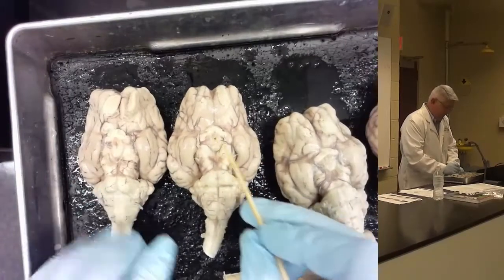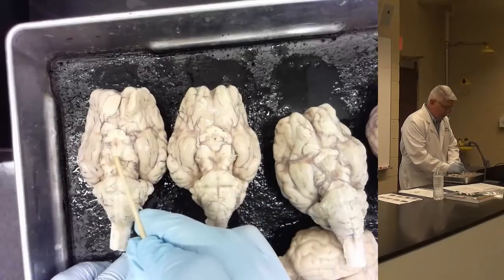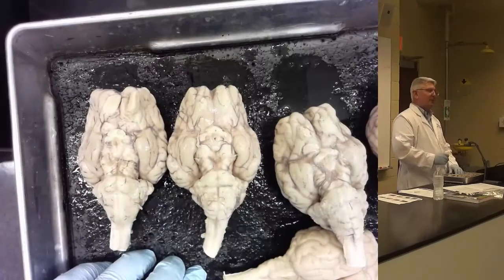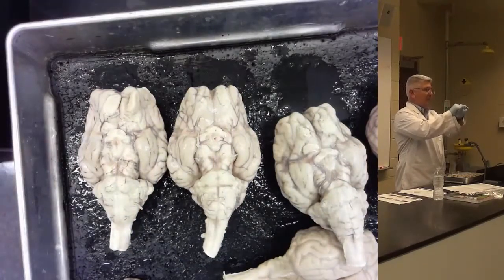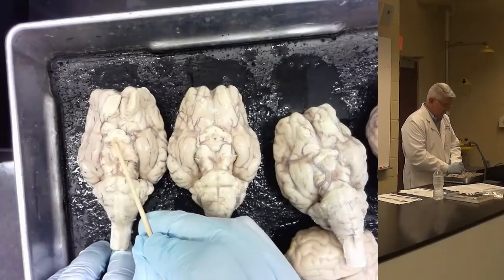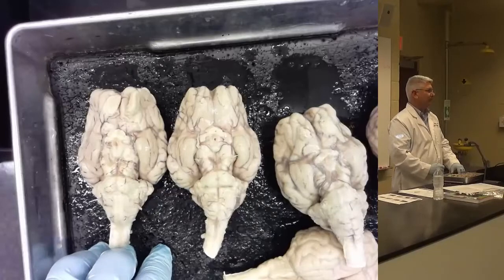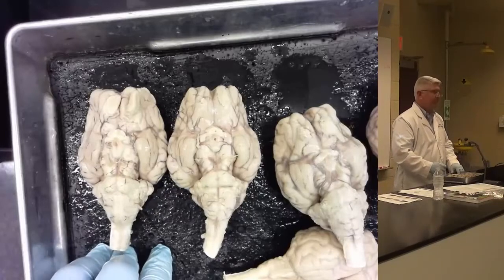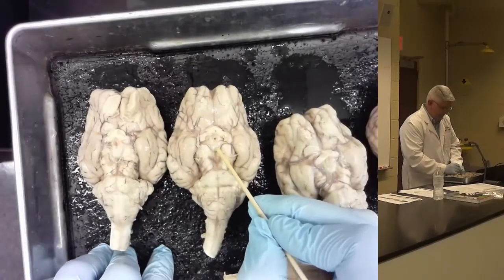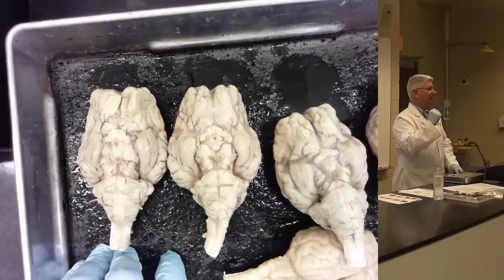It's right in the middle, and it's in between the optic chiasm and this white matter right here. And this white bulge is really two bulges, which are very prominent in the human brain, but in the sheep brain they kind of mesh together to form one big white bump. Those are called the mammillary bodies. So you have the infundibulum in between the mammillary bodies and the optic chiasm. Yes, the infundibulum is in between the optic chiasm and the mammillary bodies. The mammillary bodies are a distinct white midline bump on the bottom of the brain.